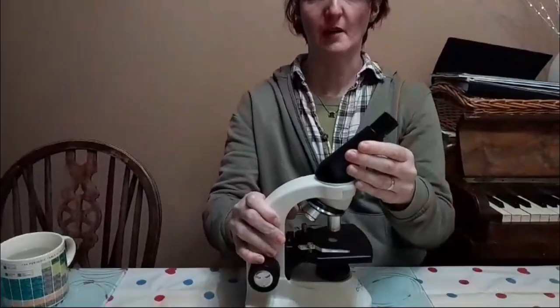Hello, my lovely students, and we're going to talk through the 2 required practicals that you need for the B1 paper. So the first one is how to use a microscope. And to help me, I have got my trusty microscope here.